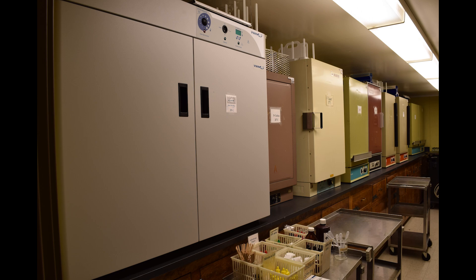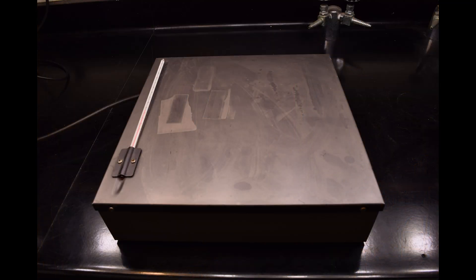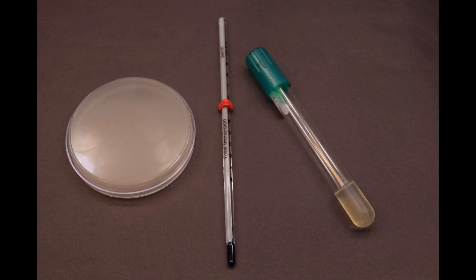I solved this problem by experimenting with a few pieces of equipment and ideas and eventually found success with a slide warmer. I stuck a thermometer into the bacterial media which is used to grow bacteria to calibrate the temperature of the media.